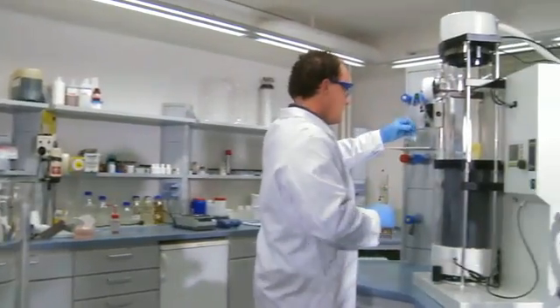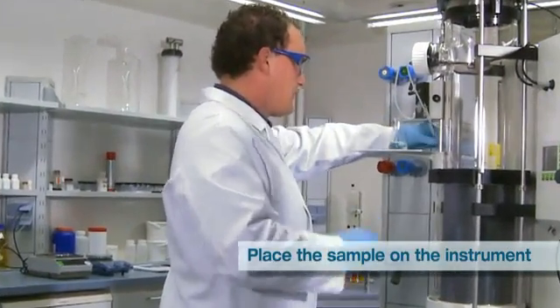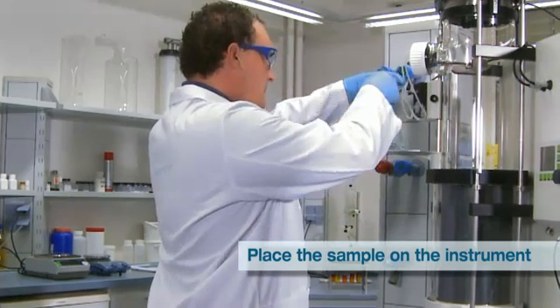Place the sample on the device and insert the feed tubing, one for the inlet and one for the outlet of the sample.